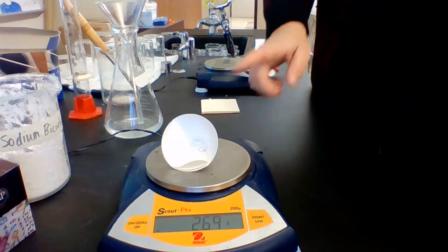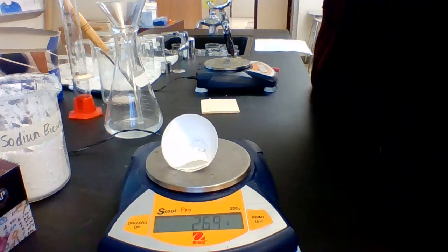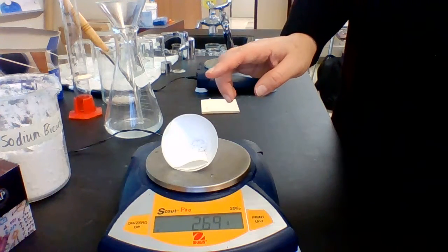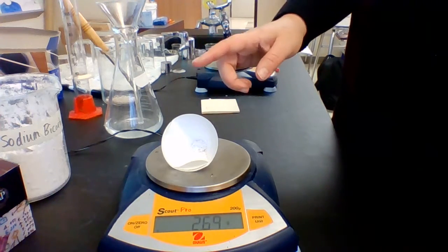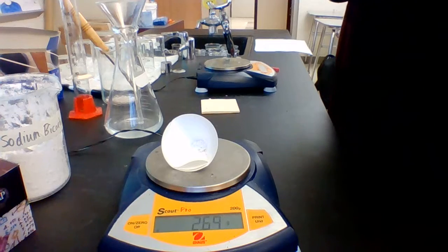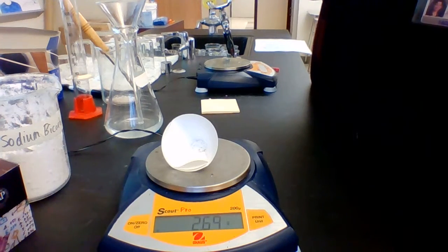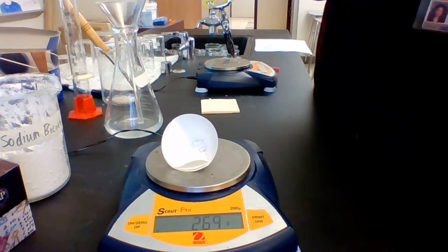This was not dissolved. This is a precipitate. It's a solid that will not dissolve in water or whatever. And it stayed in the filter paper. So this is the calcium carbonate. So we've now created calcium carbonate, and you're going to look up and see what it does and where you can find it. And we can now figure out how many moles that we got.